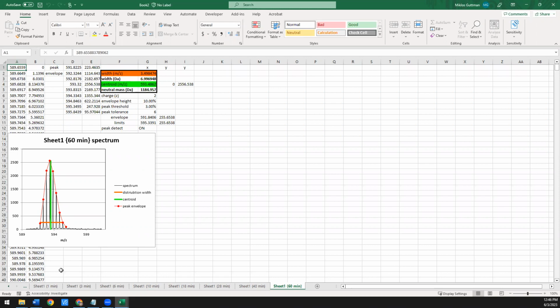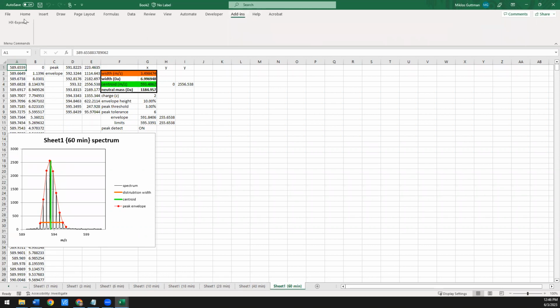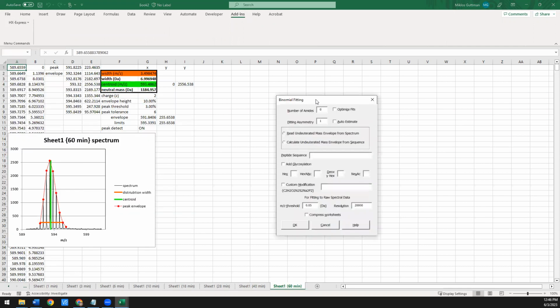So what we want to do in this case is use that double binomial approach to actually extract out the kinetics of how fast this folding process is happening. So to do this, again, the first step we need to do is apply a simple binomial fit. So here again, I'm going to optimize fits. If you have 0, it'll automatically estimate it from the peptide sequence. I'm going to say calculate, and I'm going to paste in the peptide sequence from here. No modifications or anything like that.